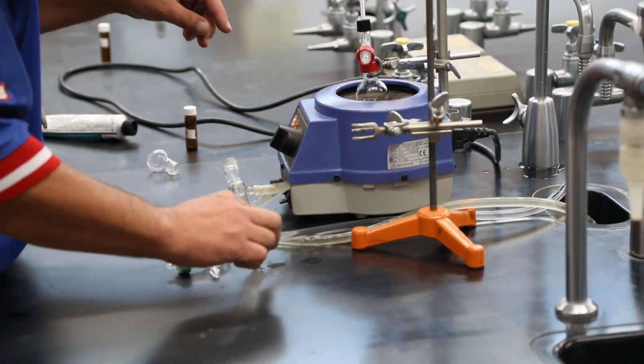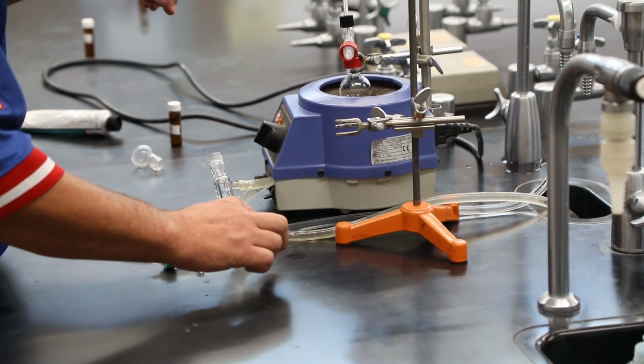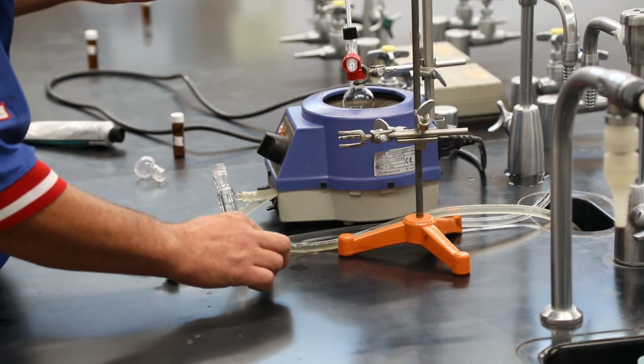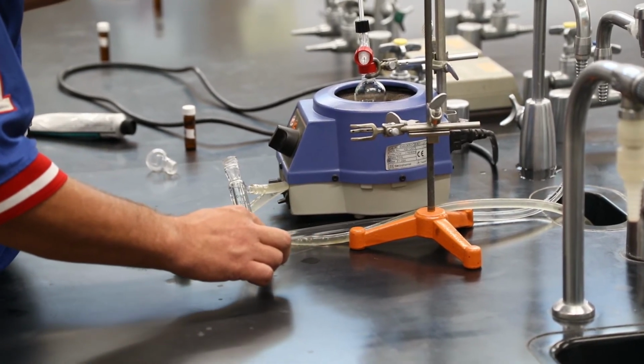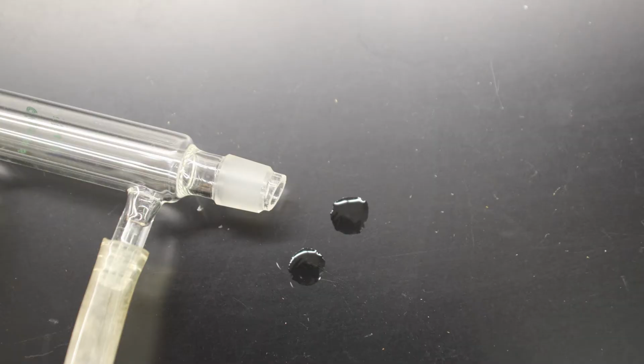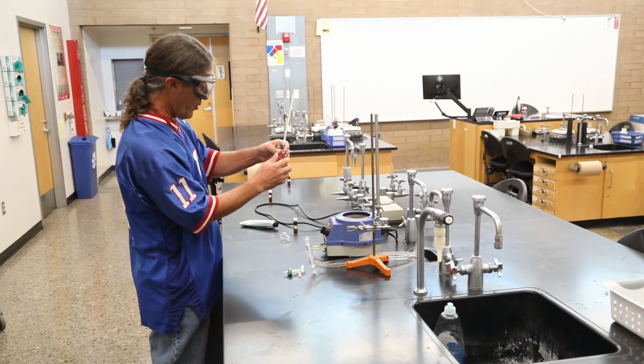And one of the things to pay attention to is if you're using something that's extremely toxic, you might want to be using gloves. This is essentially, hexane is like gasoline. So as you see, a couple of drops of hexane came out of the condenser. They're on the lab bench. They're just going to evaporate, which again, I don't like that, because now I'm going to be breathing hexane, but it's a lot like just breathing a little bit of gas when you fill your gas tank. As long as we minimize our contact there, we'll be okay.